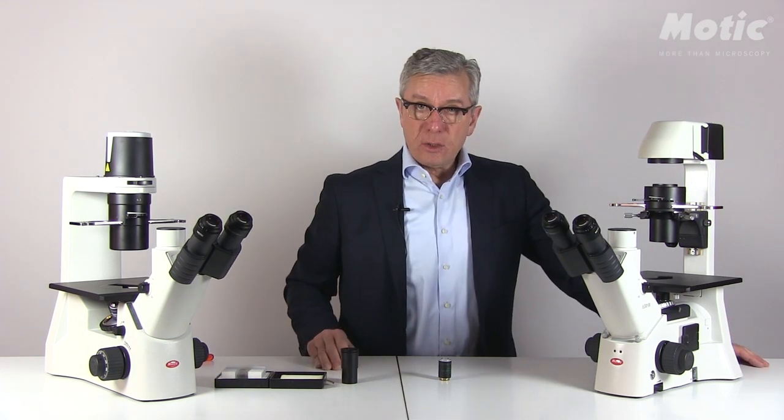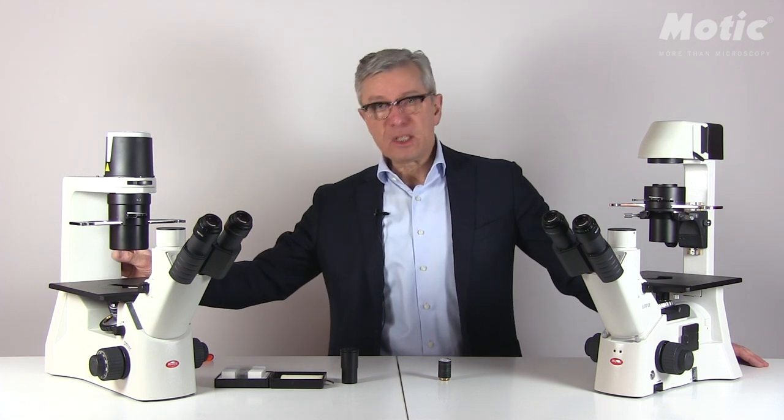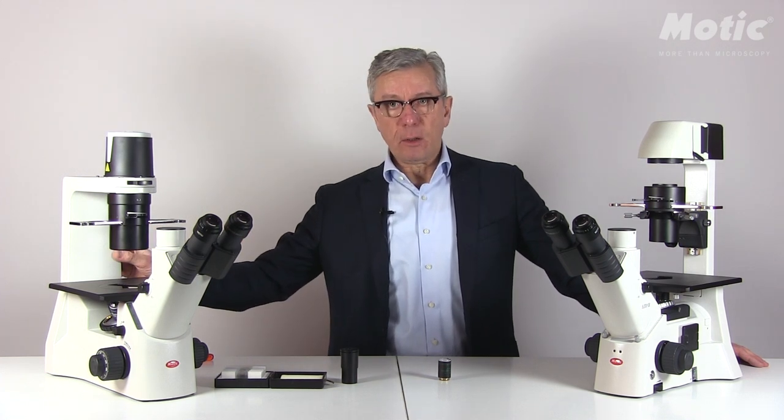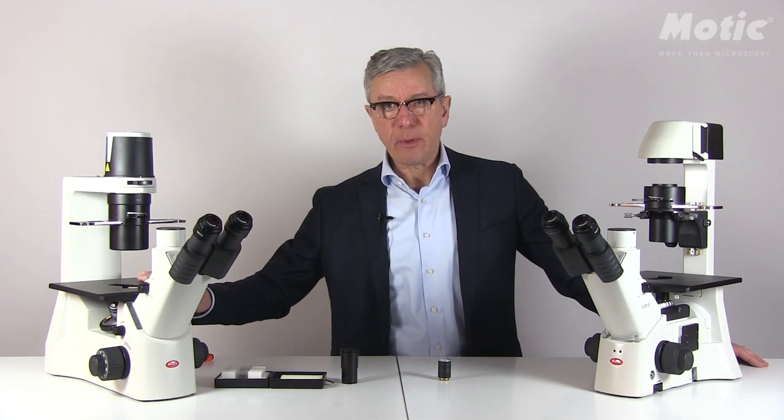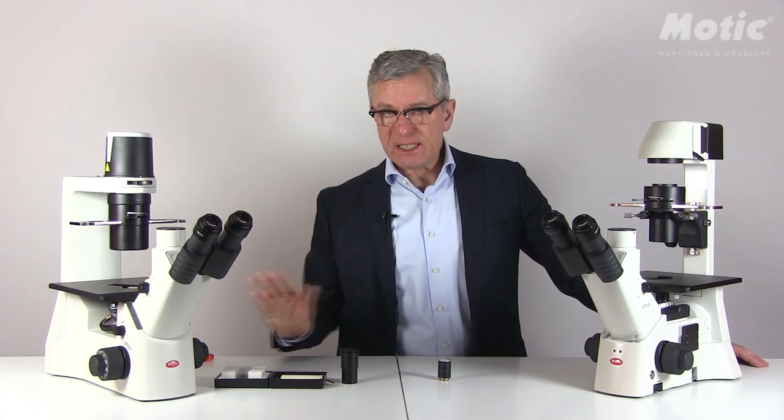Before we start with phase contrast, make sure that your complete alignment of the microscope is done properly for brightfield use. For the AE2000, this makes no problem at all, because we have no Köhler option here. So just place your sample on top of the stage and focus. That's it.